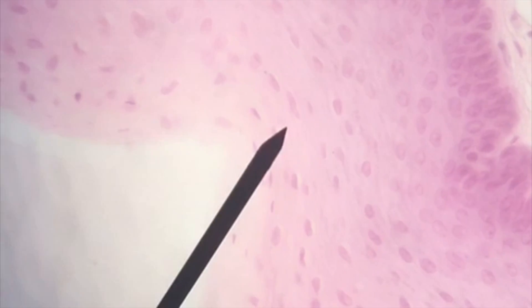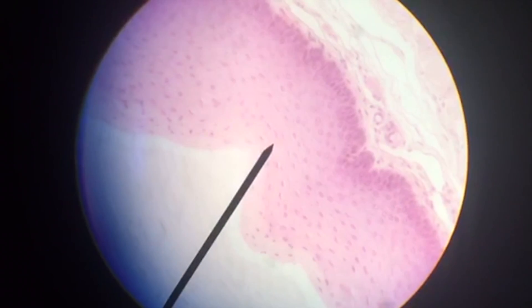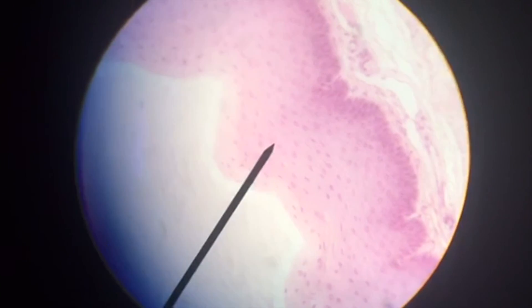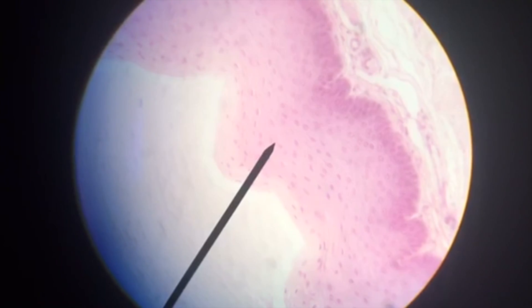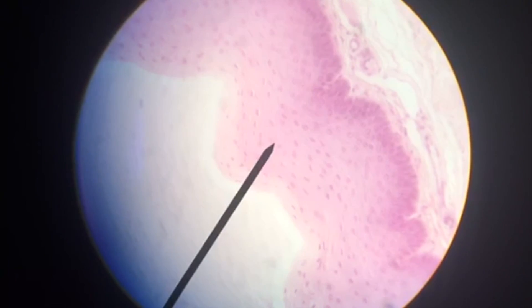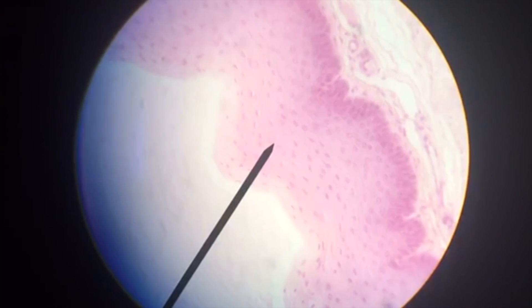Again, we're going to use the terminology of non-keratinized stratified squamous — stratified squamous without that keratinized or hardened, deadened cell layer. There is no need for that level of protection inside the mouth, the esophagus, or the vagina.